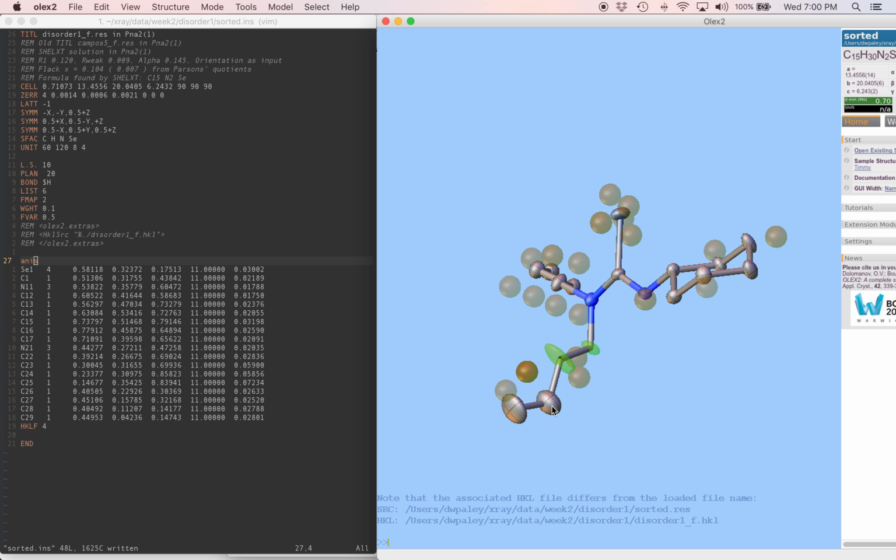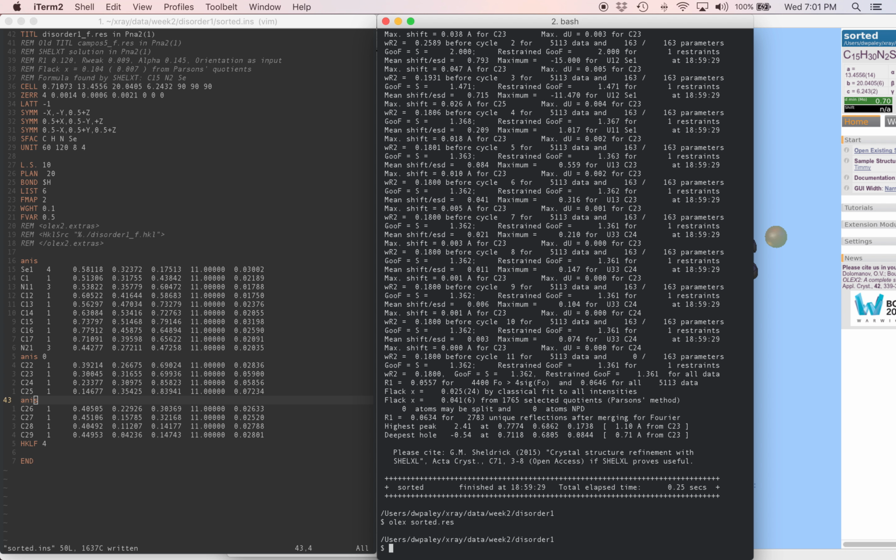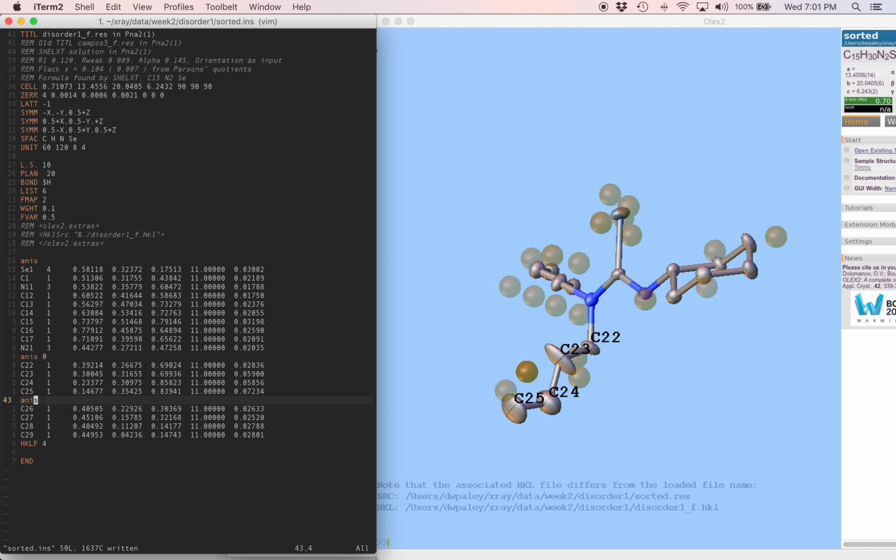And let's remember what these are. C22 through 25 should be isotropic. I'm going to do that by typing anis 0 before the first isotropic one, and then anis again after the last isotropic one. And at the same time, we talked about getting the quality of the rest of the structure as good as possible, so we can do that. And also at the same time, we'll turn down the occupancy of the disordered chain, like we talked about, to try and get the second part of the disorder to show up in the difference map.